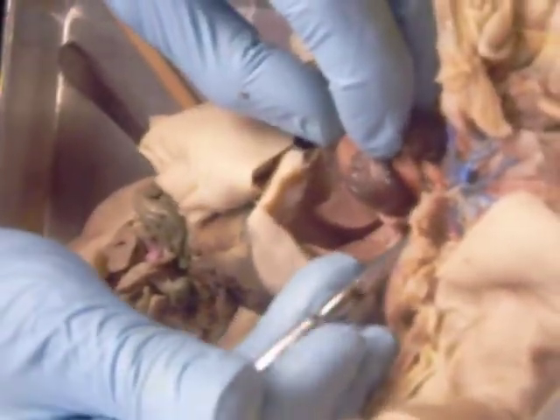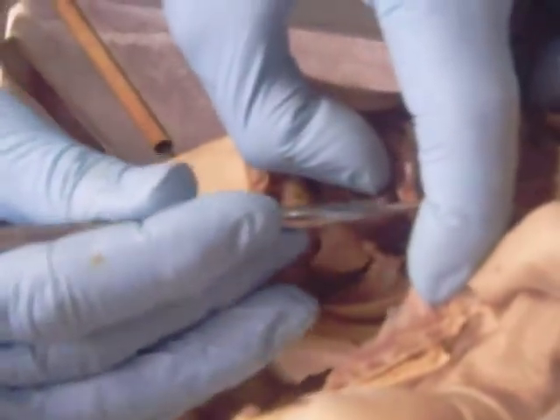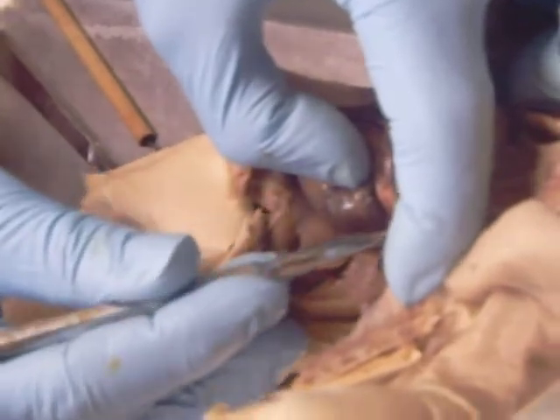And right there is the aortic arch with the brachiocephalic coming off of it. And it goes up into the common carotids. You can see one here and one over there. It also has a subdivision right here off of the arch. There's the left subclavian off of the arch going into the left arm.